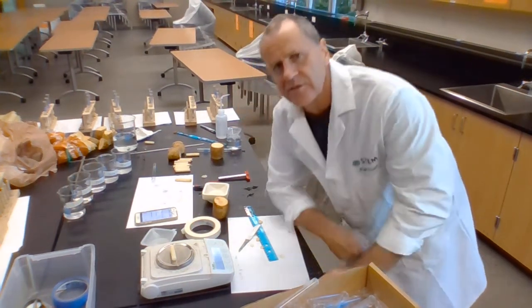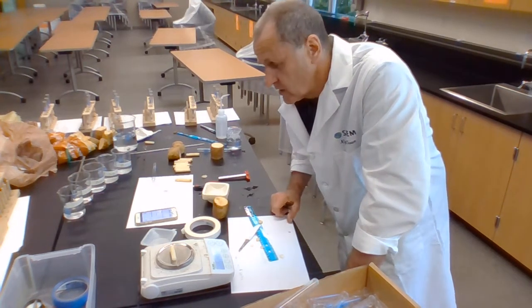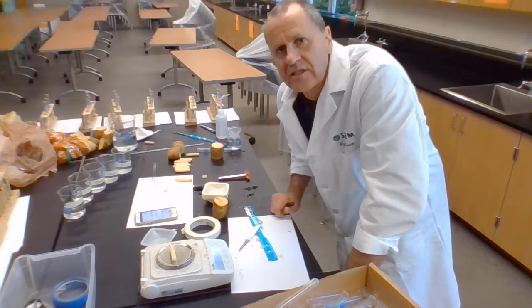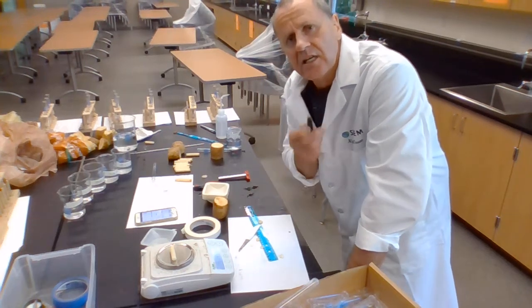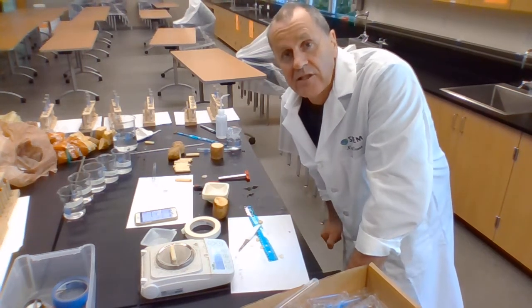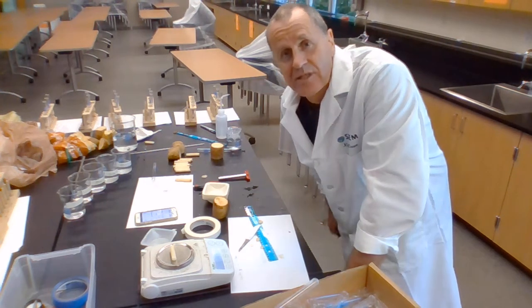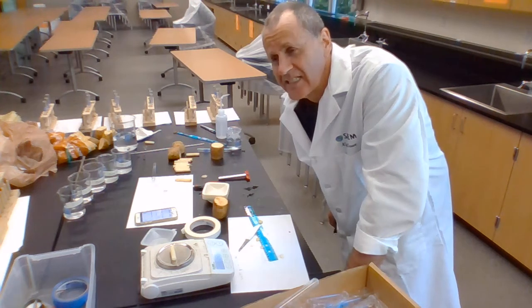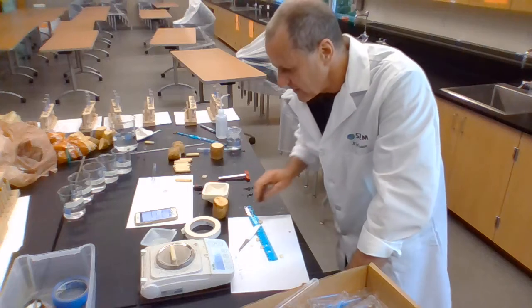At the end of the experiment, I'll find the final mass, and I will then find the difference, and then I'll be able to look at the percentage change by comparing the difference to how much the mass was at the start. You, of course, are going to be at home, and you're not going to have a balance as good as this. But you've already made a balance, I guess, because you've done something like this at home already, at least in chemistry.